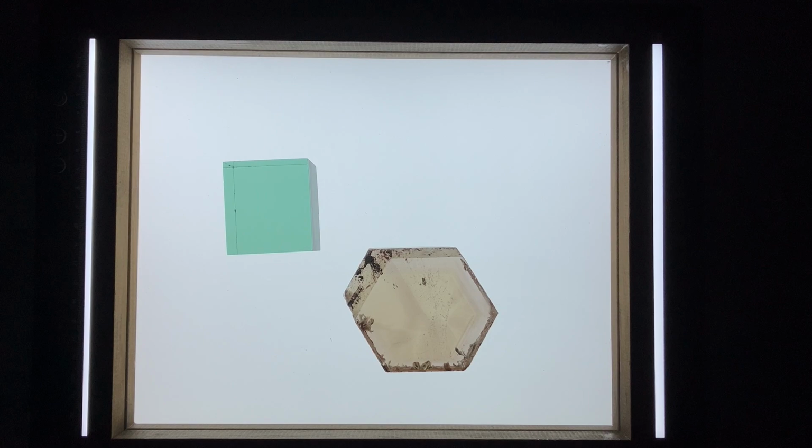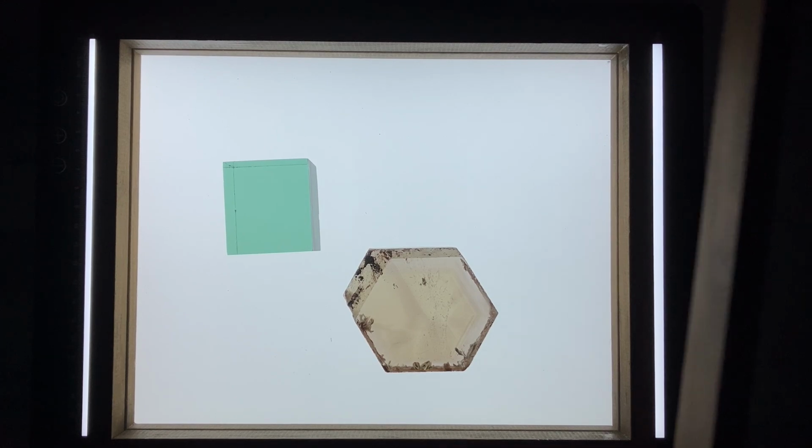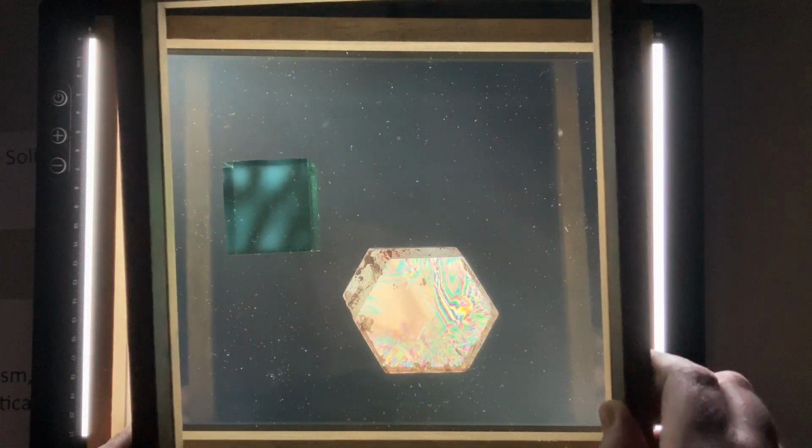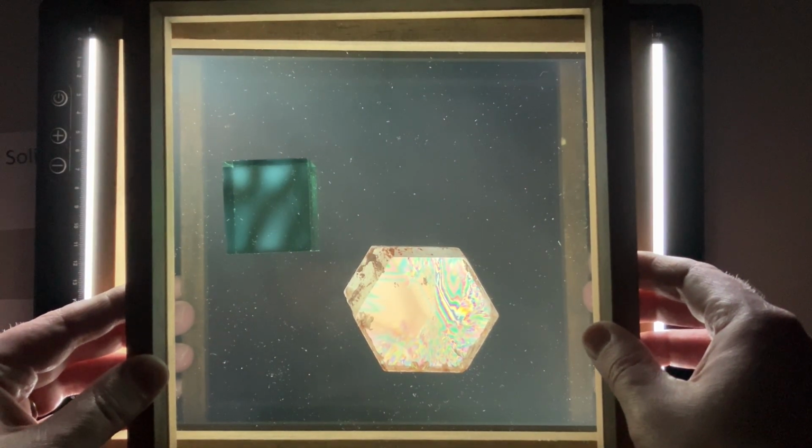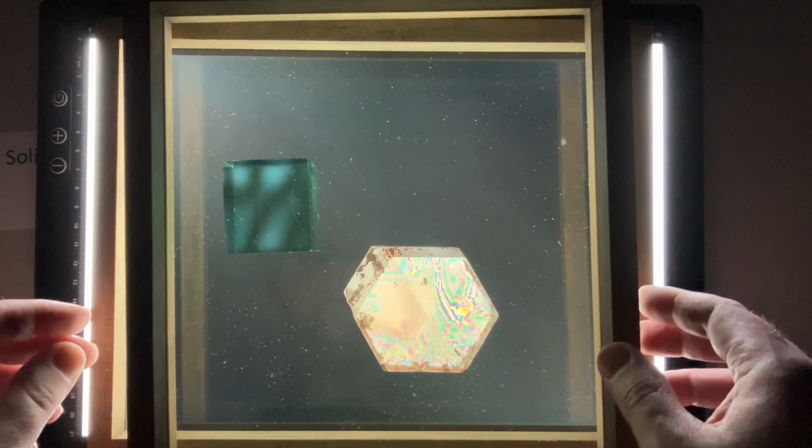different in different directions. Let's continue on and bring in our upper polarizer now to take a look at our glass and our quartz with crossed polarizers. Right off the bat, you'll notice our quartz is letting a whole bunch of light through and also has some interesting rainbow effects going on.